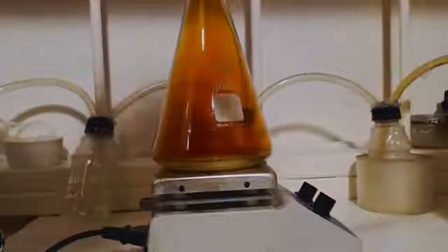I'm trying to heat on it a little bit more and see if I can keep it going until it doesn't make any more nitrogen oxide. As you can see, there's no more gas coming off. Actually, it's boiling right now and it's distilling pretty much. And no more nitrogen oxide gases are being produced. So that must be really, really dilute acid. I'm going to let it boil for a little bit, and then that little piece in there, it's like a really thin piece. I'll take it out of there and filter it.